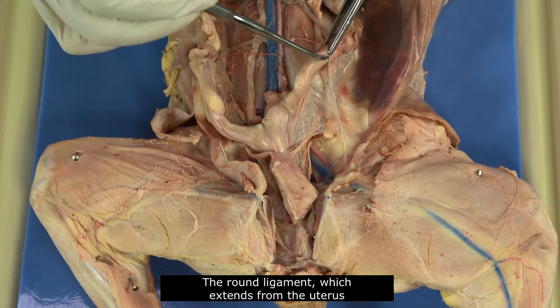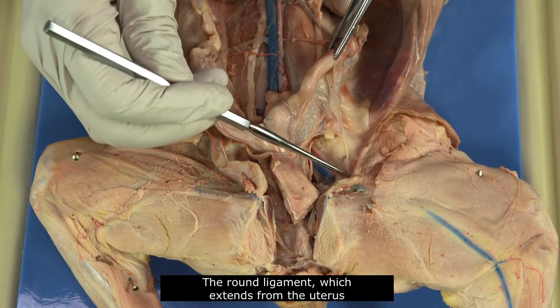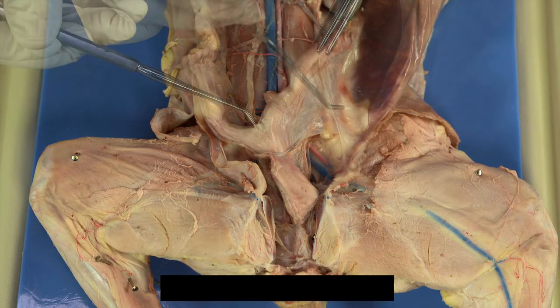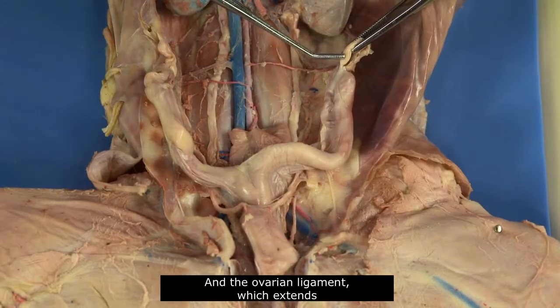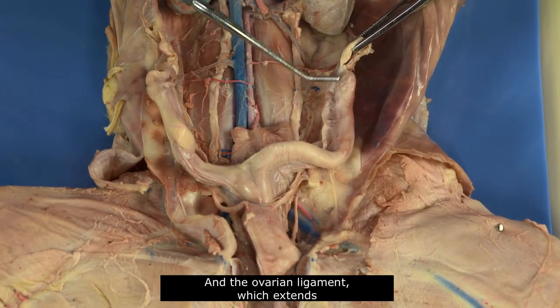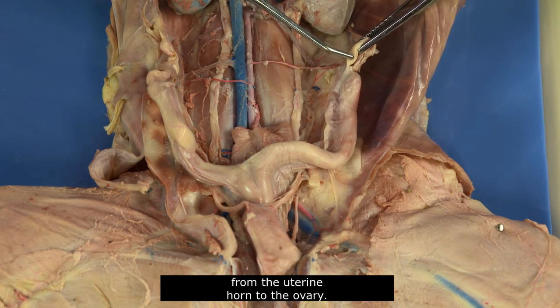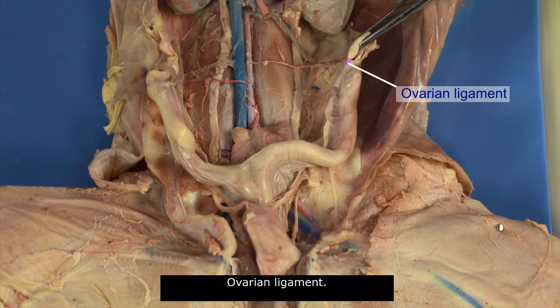The round ligament, which extends from the uterus to the anterior body wall, round ligament. And the ovarian ligament, which extends from the uterine horn to the ovary. Ovarian ligament.